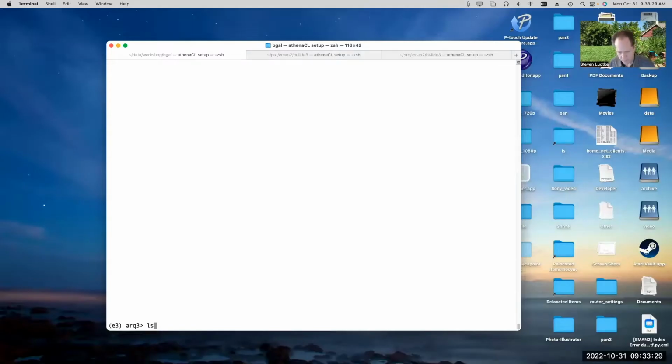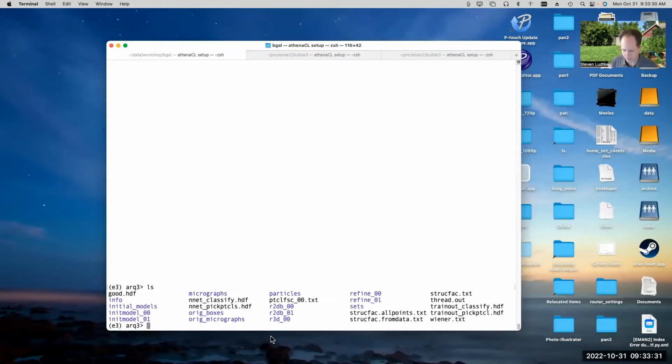So since last week, I went ahead and ran several different things. I ran a couple of canonical refinements, and I ran refinement using the new refinement program. I ran the 2D class averaging a couple of different ways. Anyway, this gives us a variety of different things that we can look at while we're talking about the rest of the tutorial today. So I have the canonical approach, but also some of the newer approaches which aren't fully documented in the tutorial yet.